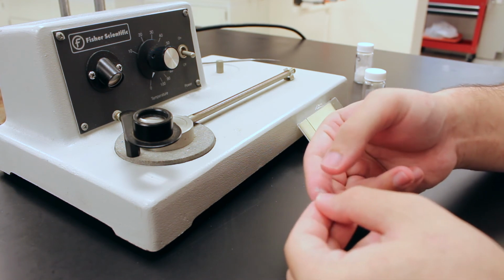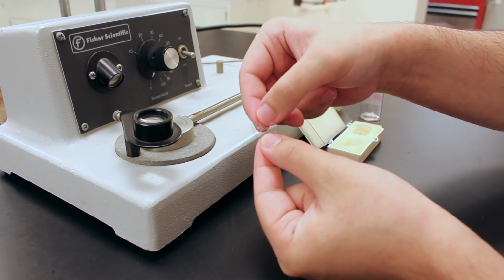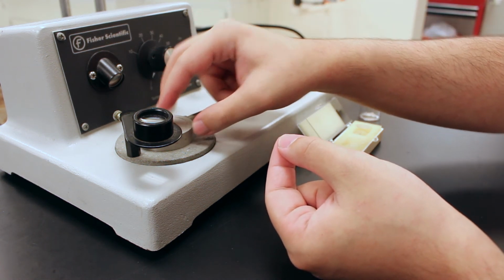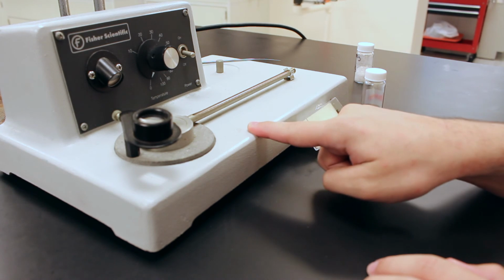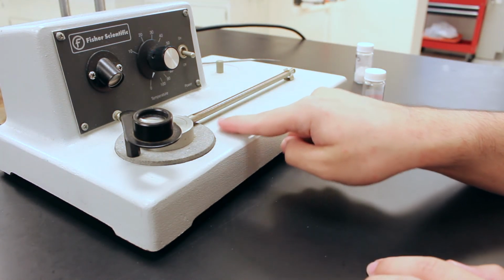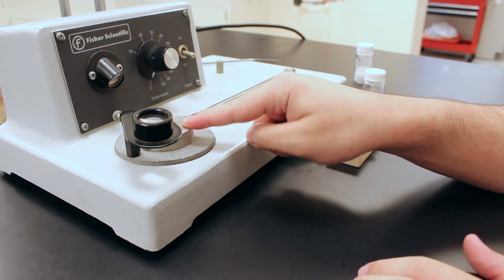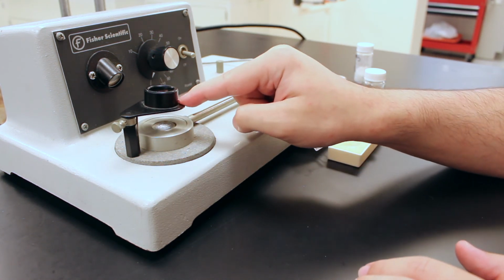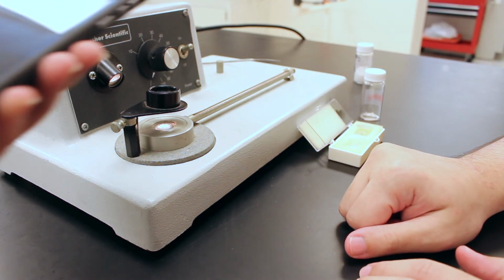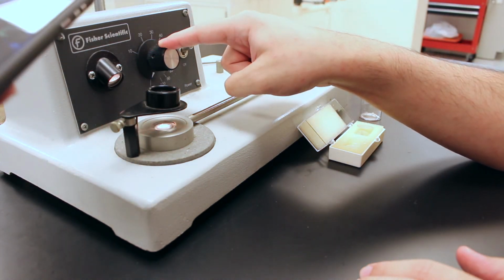Okay. You can see they're sandwiched together, and then you place these two onto the stage of the melting point apparatus. And the melting point apparatus consists of basically this thermometer here, which allows you to know what temperature it begins melting at. You have the stage here, which has a heating element, and then you have a magnifying glass here, which you can look through. And when the unit is switched on, there's a little bit of a light, which helps you see the crystals inside of it. And this knob controls the temperature right here.